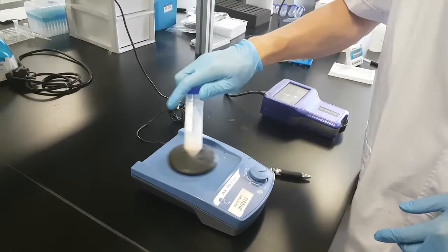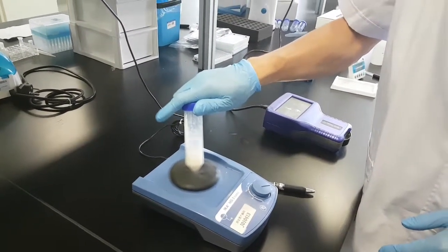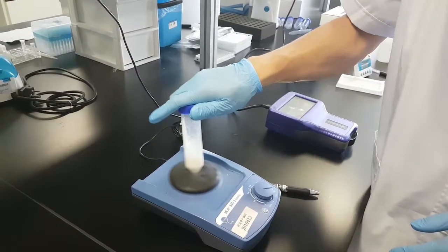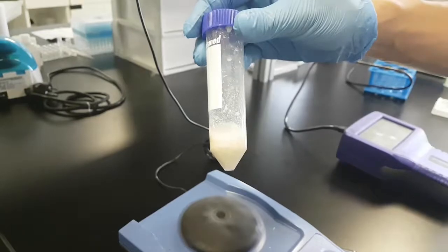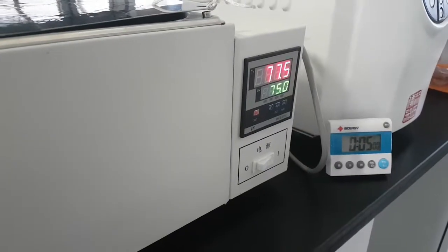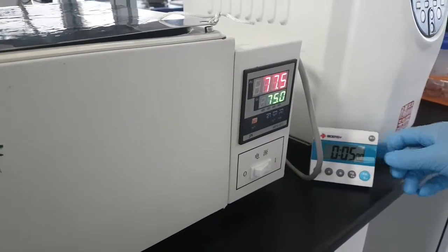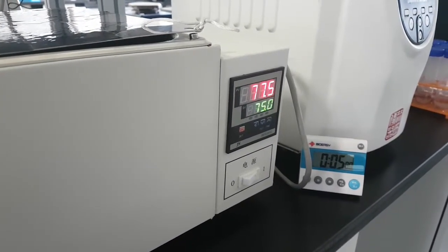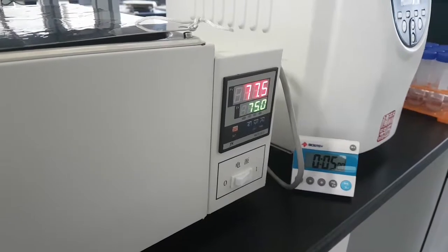Vortex for 30 seconds at 2000 to 3000 rpm. Next step will be putting our sample into the water bath and incubate for five minutes at 75 degrees.